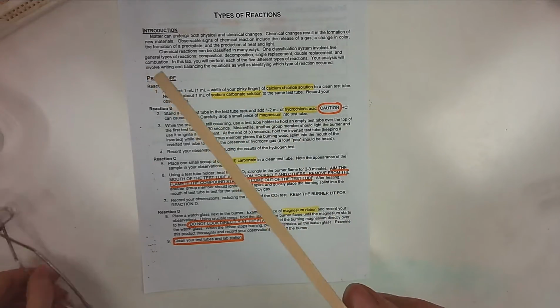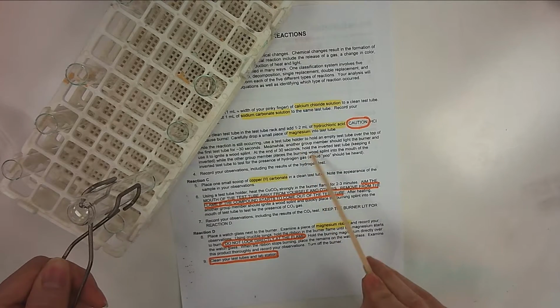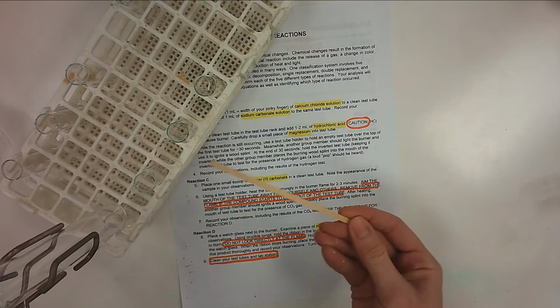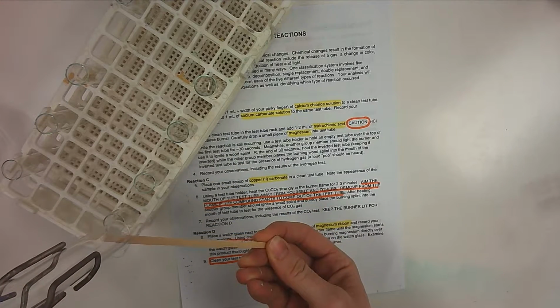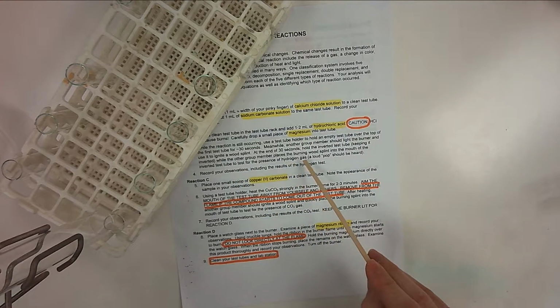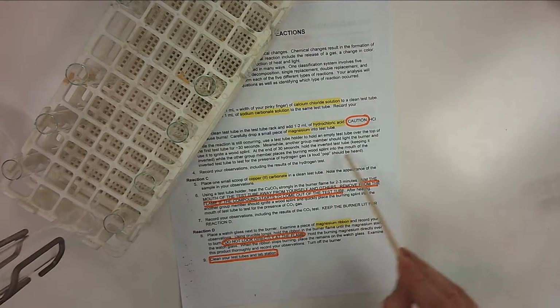All right, so once that 30 seconds time limit is up, and I'll move this over here to help. So once your 30-second time limit is up, what you're going to do is keep your test tube inverted. You're going to lift it up so you're not tilting it to either one side. You're just lifting it straight up. Then you're going to place that lit, this is a wood splint, right inside. All right, and you are testing for the presence of hydrogen gas. So if you have done this successfully, you will hear a loud pop.